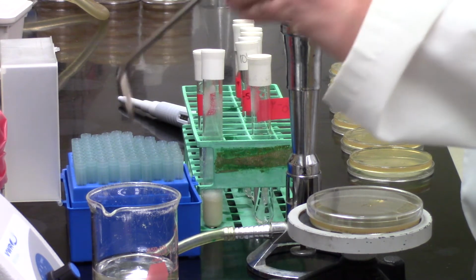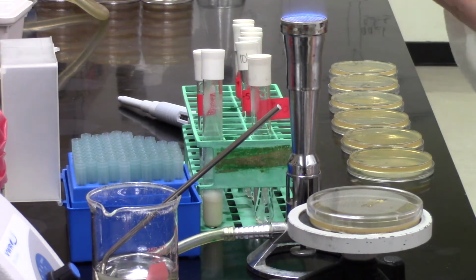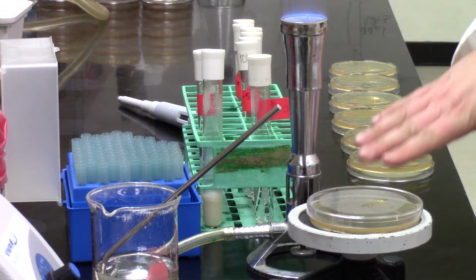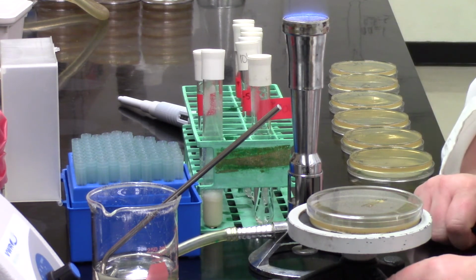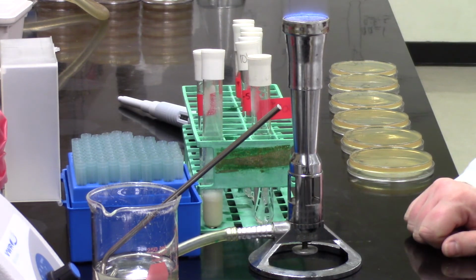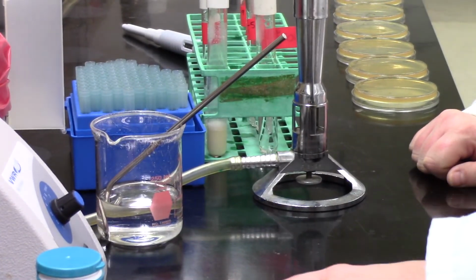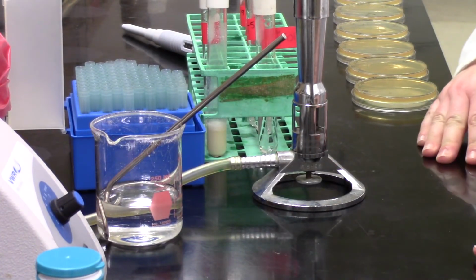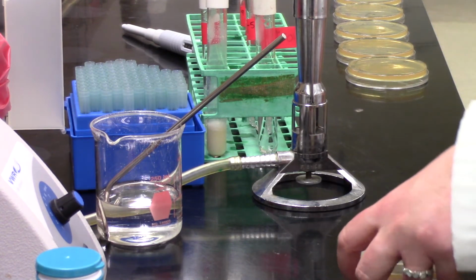And now you're going to clean off your spreader. So you're going to put it into the 70% ethanol where any bacteria are going to be killed. You do want to be careful always with spreaders that what you'll notice when you're working with them is when you get them into the 70% ethanol and you flame off that spreader, there'll be flames on that spreader as the ethanol burns off.